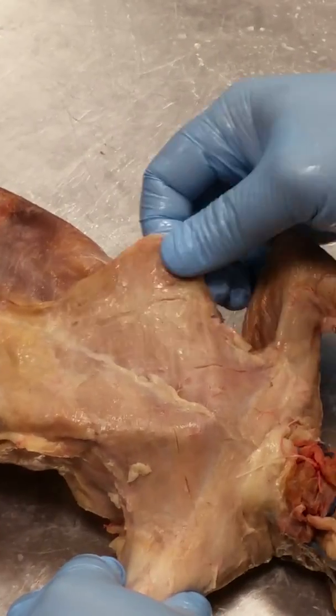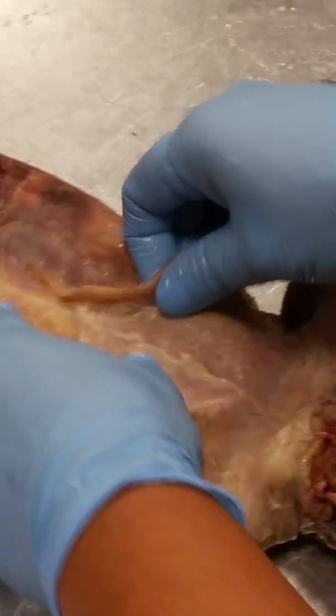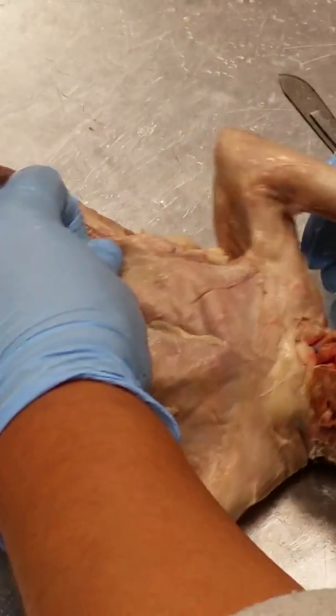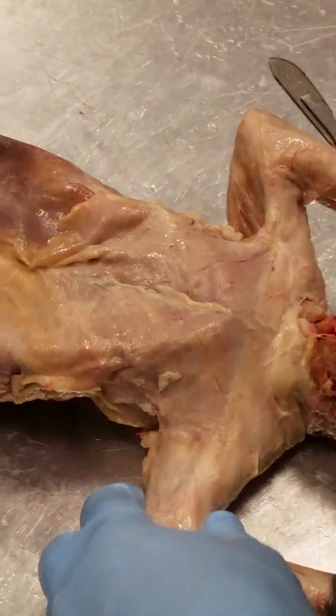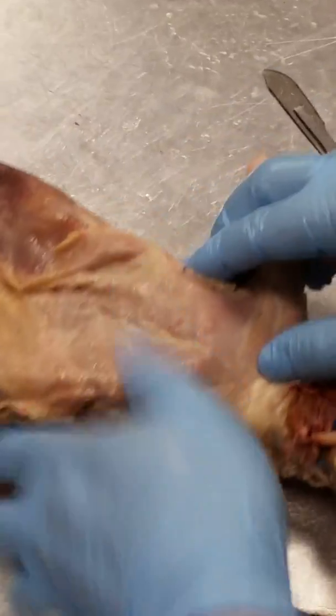Okay. How's it go again? Yeah. It's a tough crowd, the second group. Okay. Xiphihumeralis, pectoantebrachialis, levator scapulae ventralis. Should I try it again? I'm going to try it on this side.